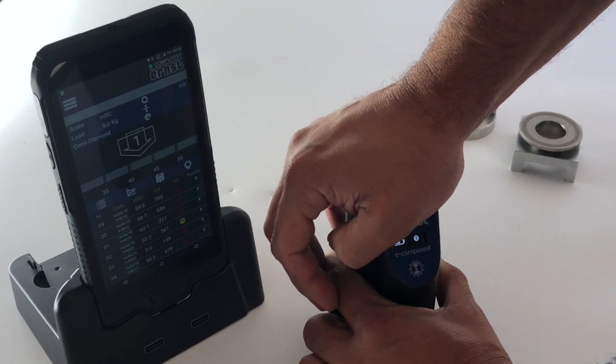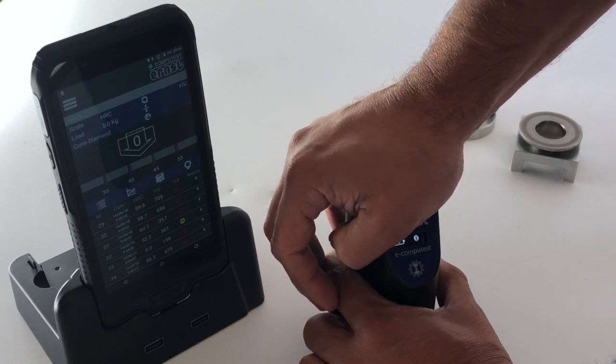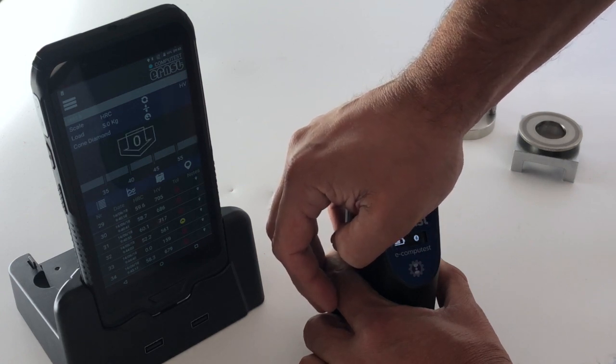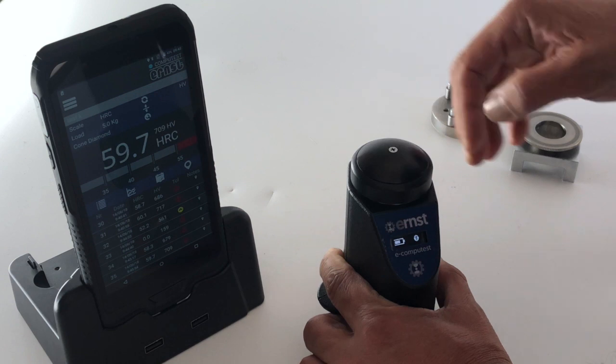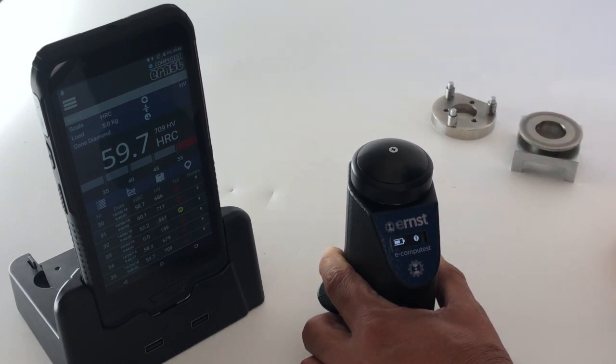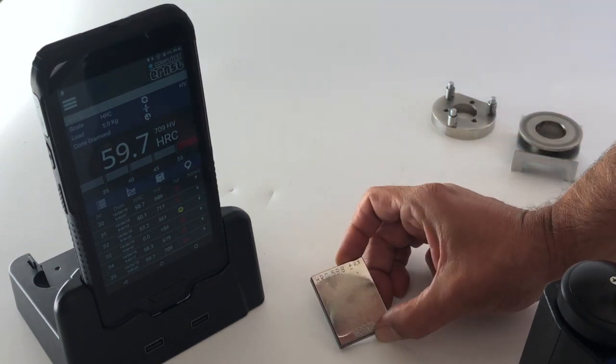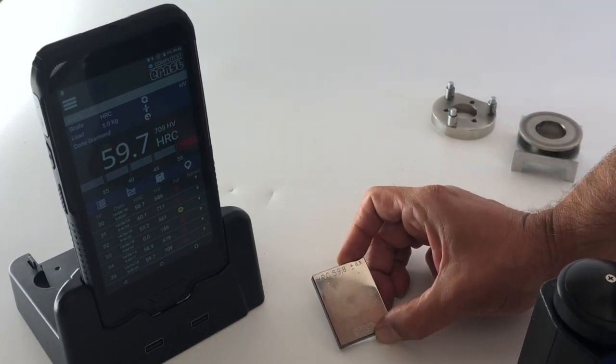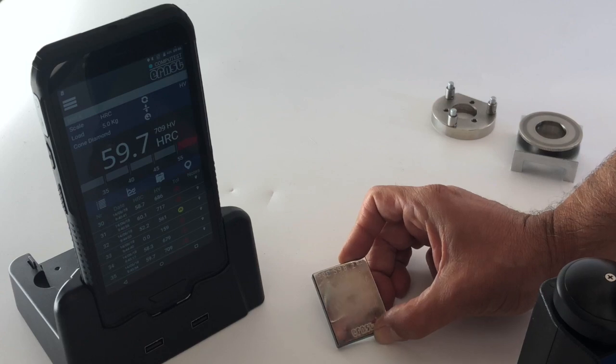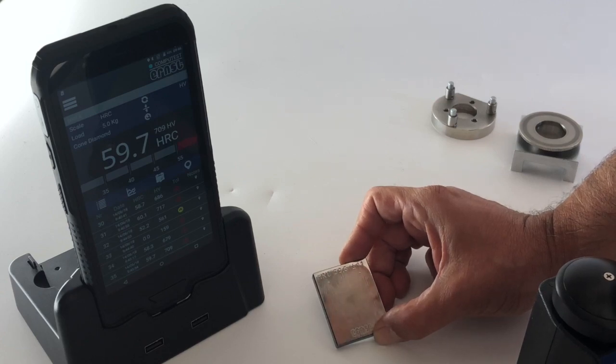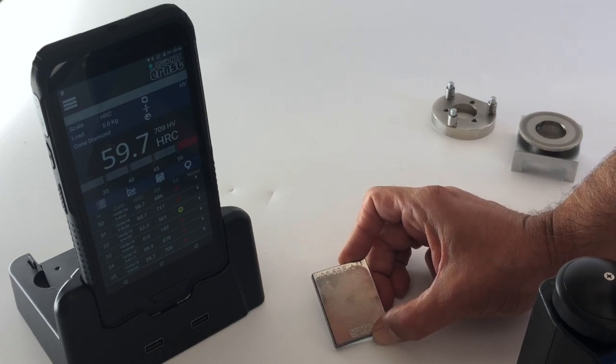Let's wait, and then back slowly. You got 59.7, which is exactly what it should be: 59.8 plus minus 0.5. That's perfect.